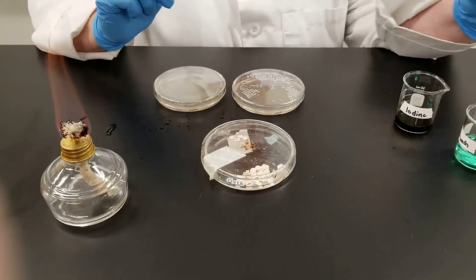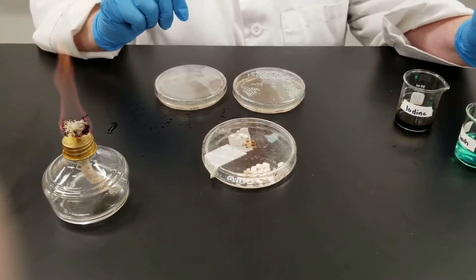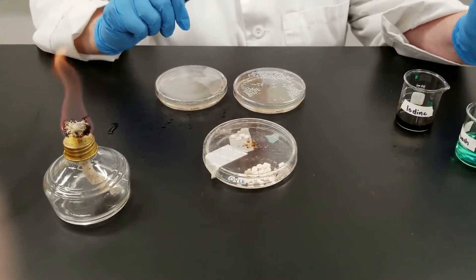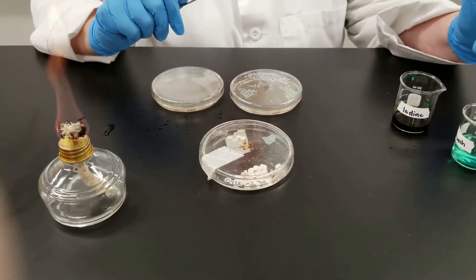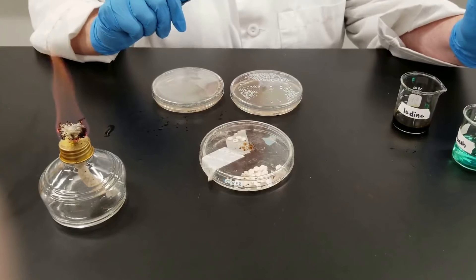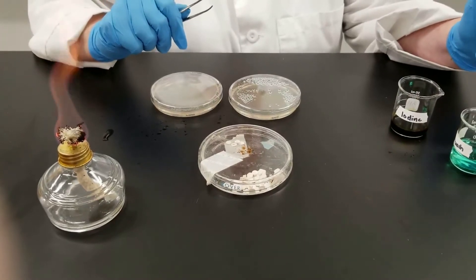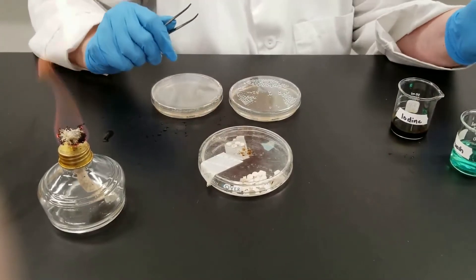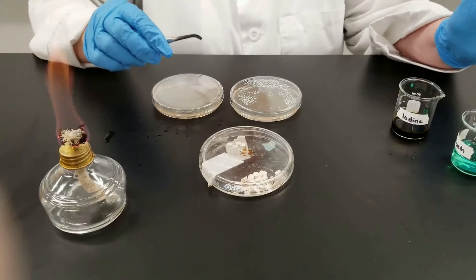We're going to test the effects of different disinfectants, antiseptics, and different chemical agents on whether or not they will inhibit the growth of bacteria. What's the effect on bacterial growth?